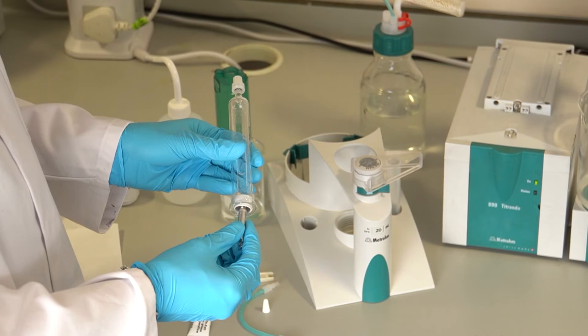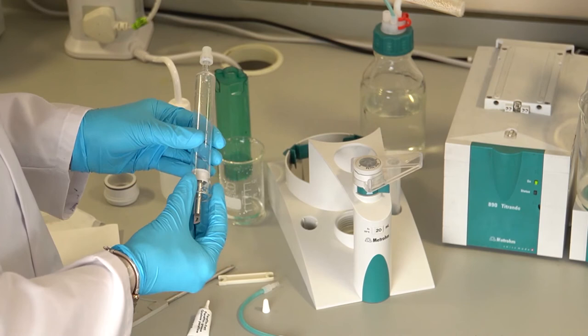Re-insert the piston approximately one centimeter into the glass cylinder. Inspect for leaks and reinsert into base and cylinder housing.